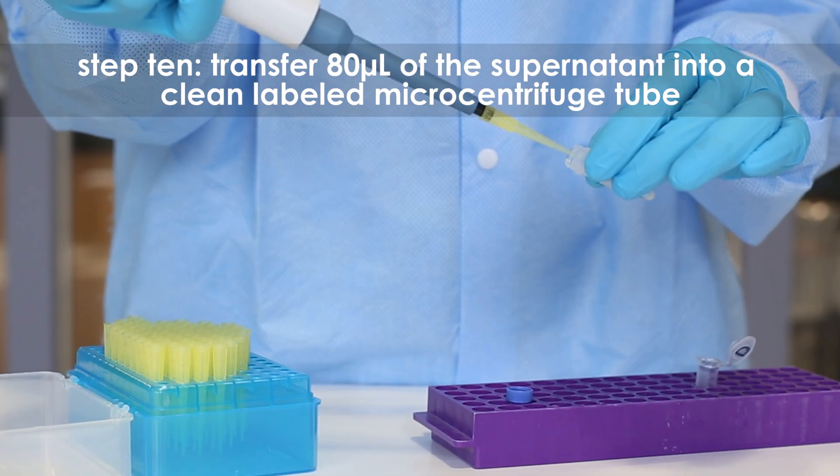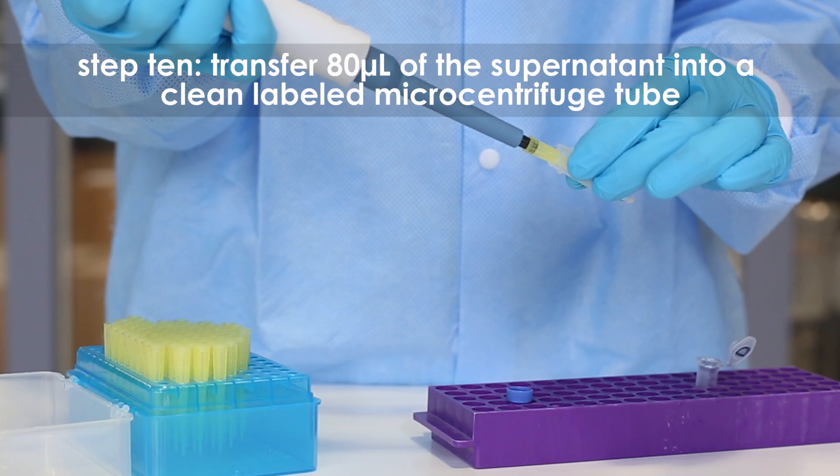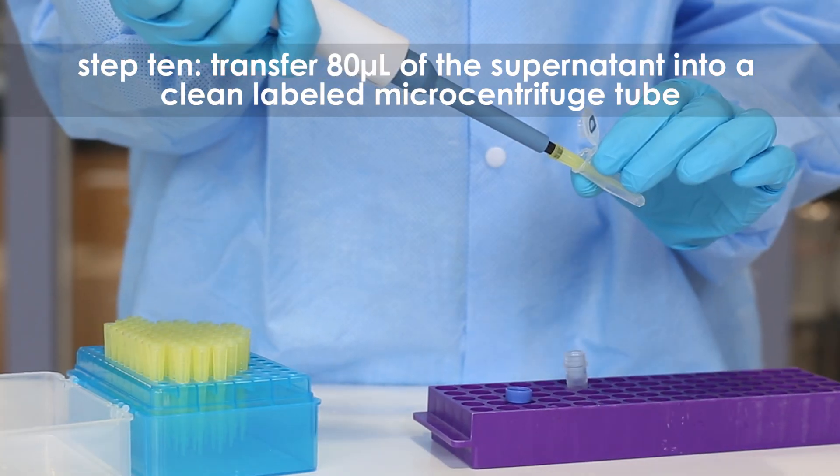Step 10: Transfer 80 microliters of the supernatant to a clean, labeled microcentrifuge tube.